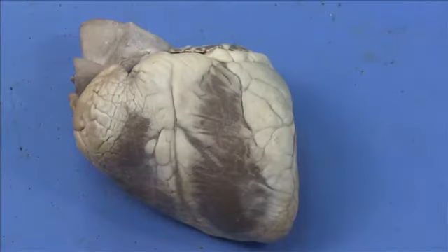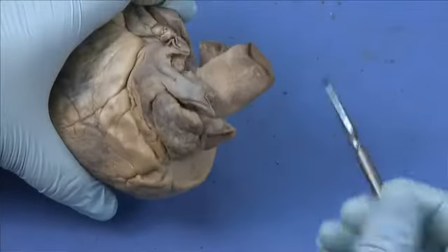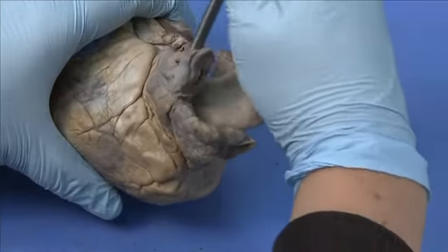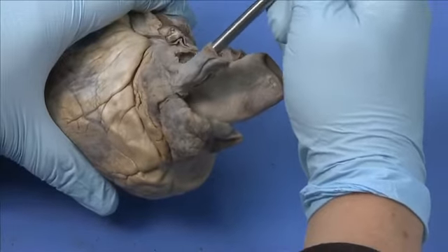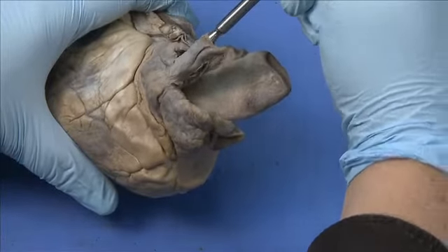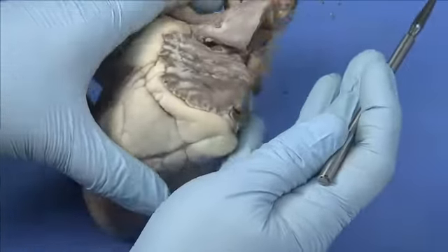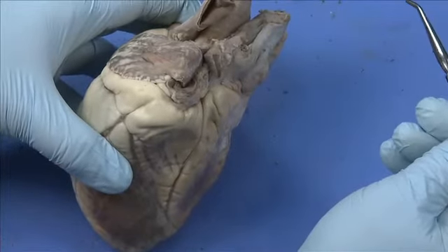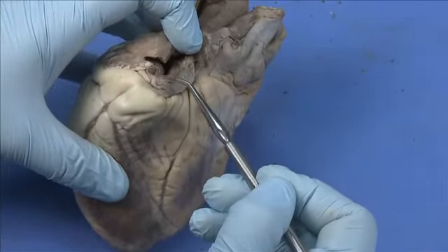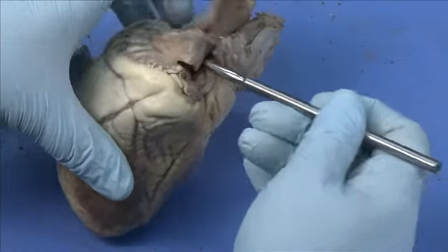You may be able to see some of the smaller vessels entering and exiting the heart. If we turn the heart over to the posterior side, you can see this vessel entering into the right atrium — that's the superior vena cava. And if we look at the left atrium, you might be able to see the pulmonary veins entering into the left atrium. In this specimen it's been cut pretty close, but we can still see a little remnant of the pulmonary vein as it would enter the left atrium.